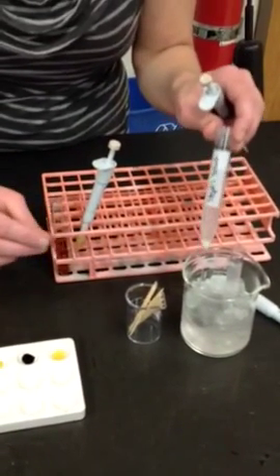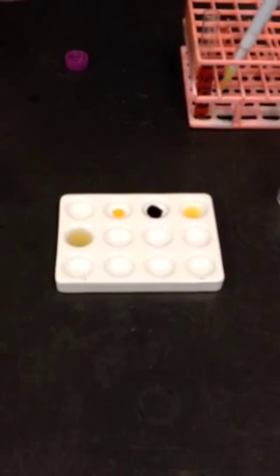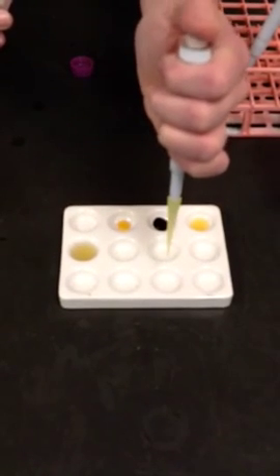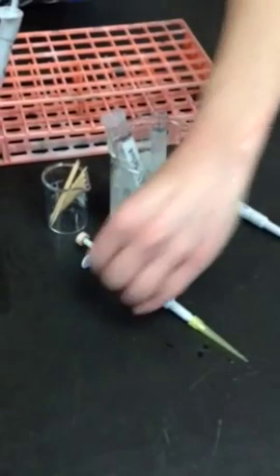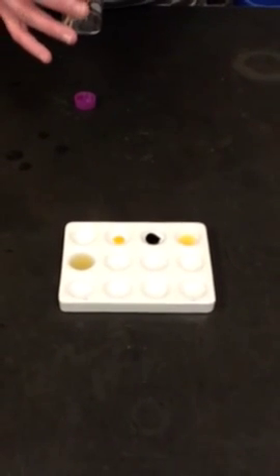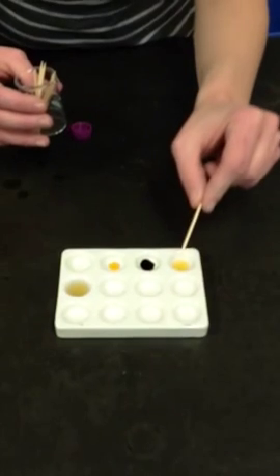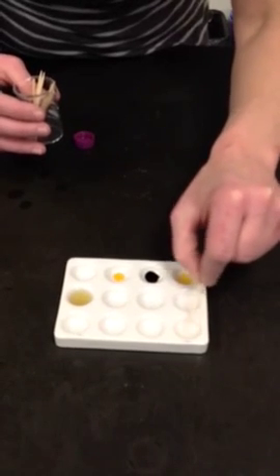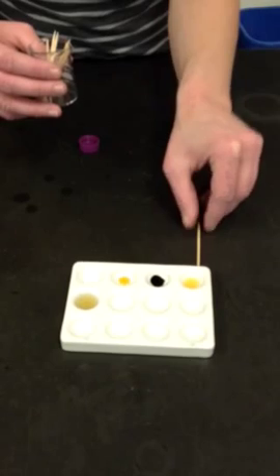I will keep the salivary amylase in these wells over here on your left. So here's salivary amylase here, salivary amylase over there, and the commercial amylase, 1 drop over here, 1 drop over there. Now just to make sure that the amylase is in contact with the starch, they need to be in contact to digest, I will stir with a toothpick, and I will make sure I use different toothpicks in the wells that contain different types of amylase.